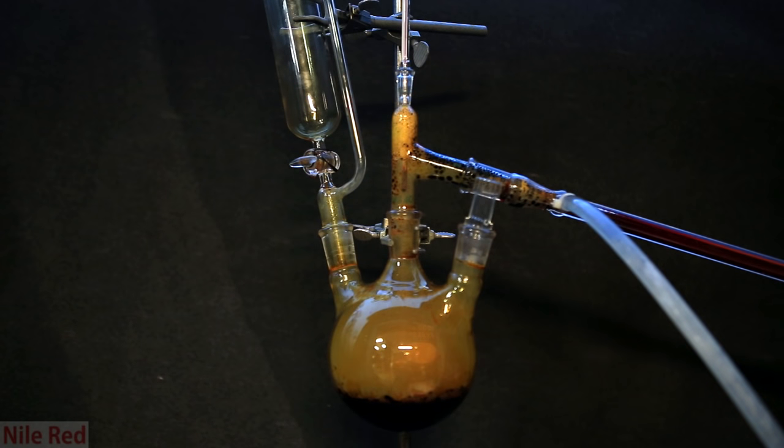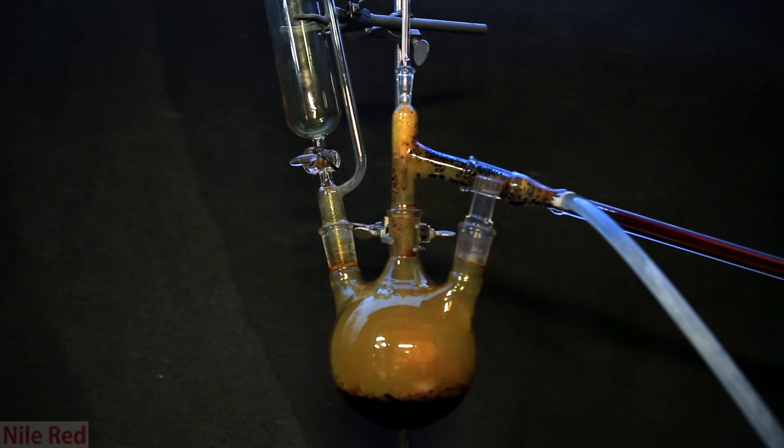As the flask cools, you can see a lot of white and yellow vapors moving around. After we wait a while, and everything is cool, we can start cleaning it up.